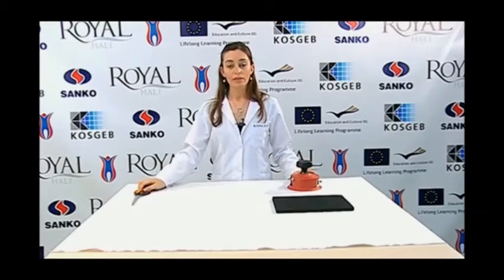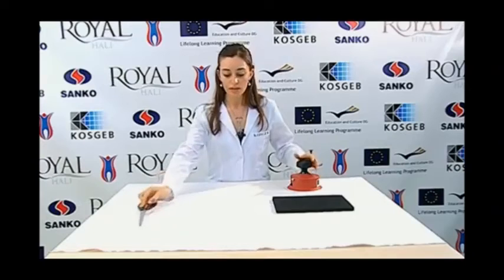The first thing to do when preparing the sample is to condition the sample under standard atmospheric conditions for at least 24 hours. If the sample contains a wide pattern and the pattern affects the mass per unit, a number of samples to contain the whole pattern should be taken. Normally, the number of samples taken is 5 for the experiment. Primarily, the sample is laid on a flat surface.